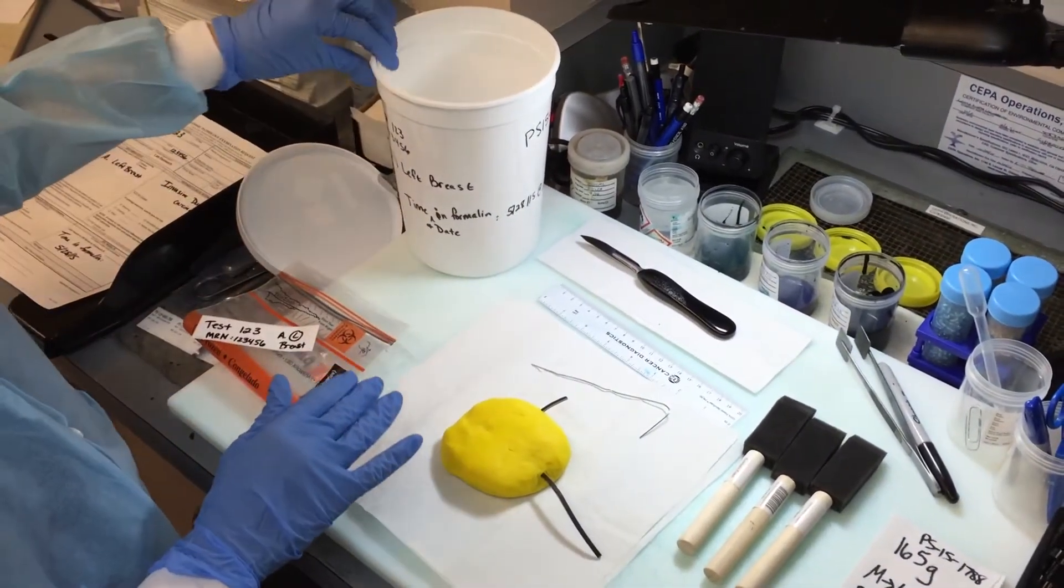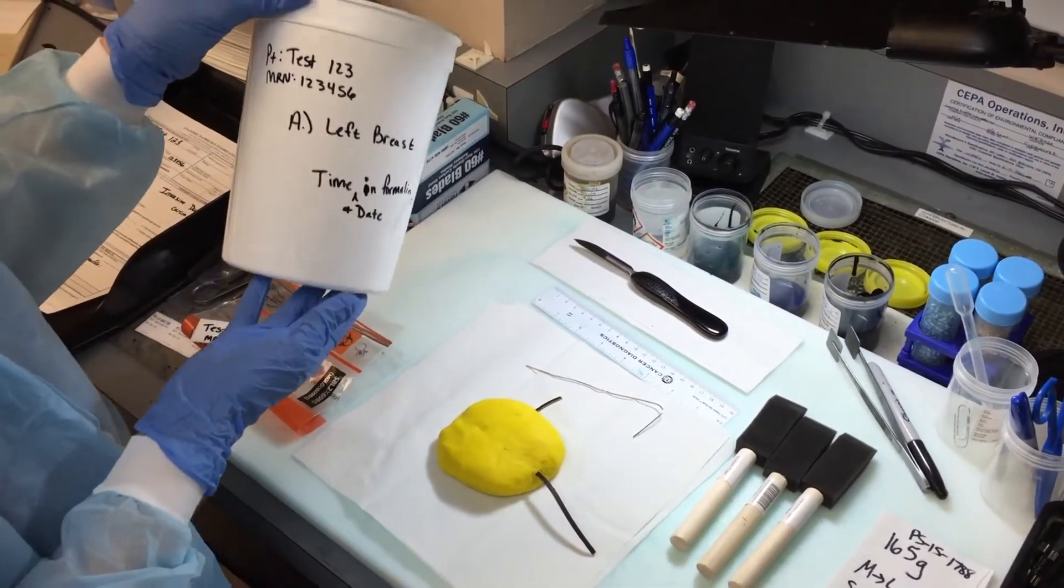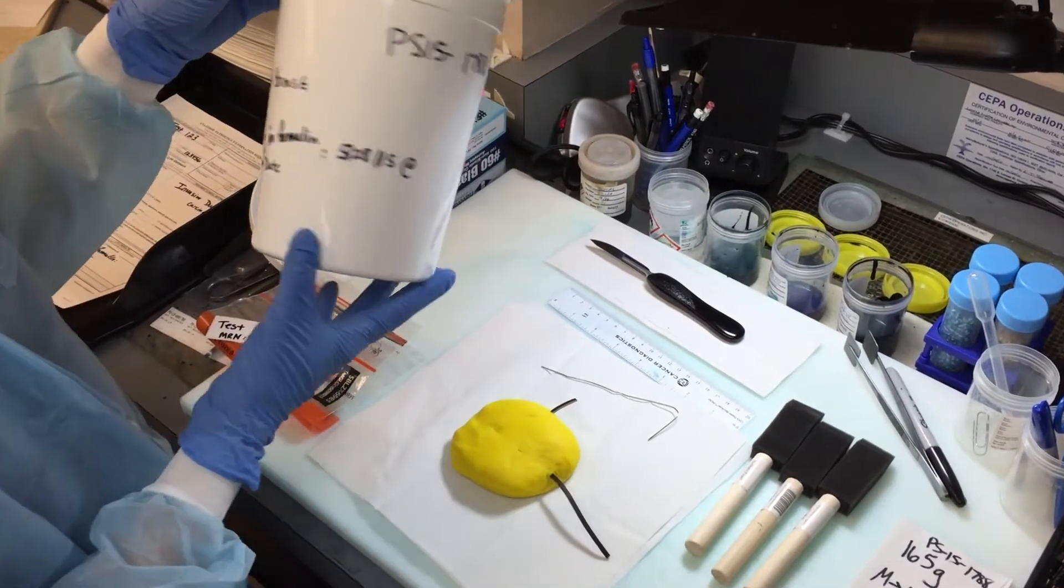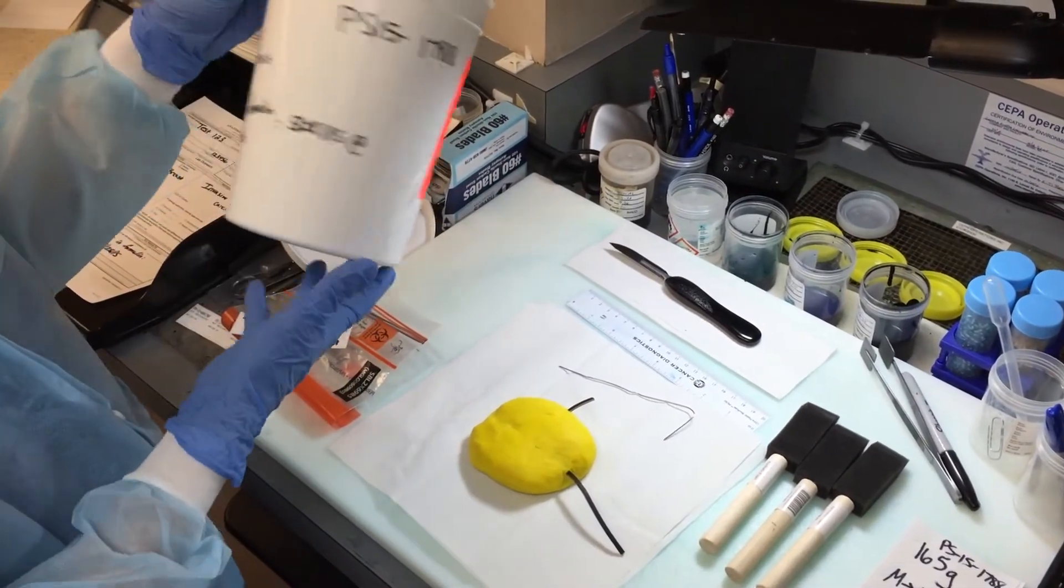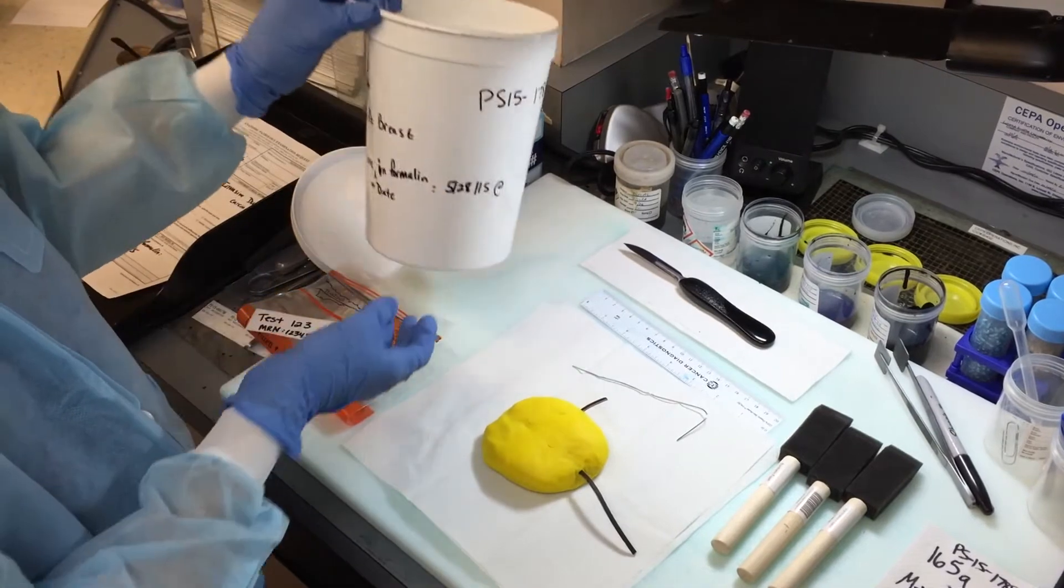The next thing is to also have a container labeled with the patient's name, the specimen, the specimen number, and you're going to note the time in formalin.